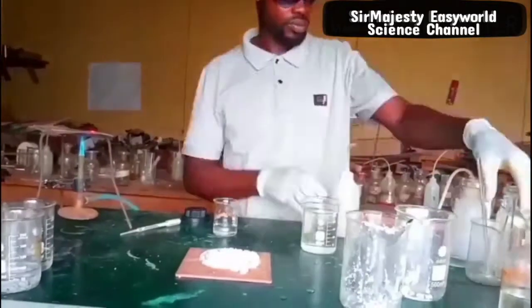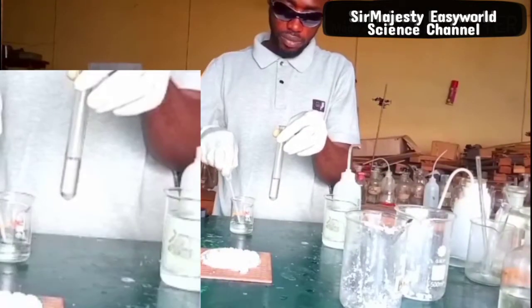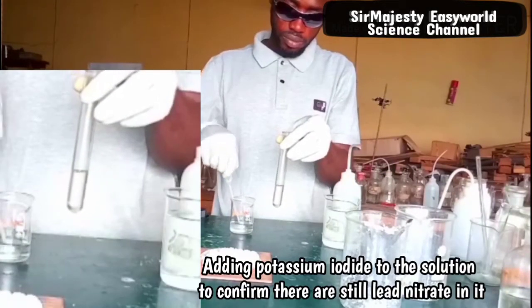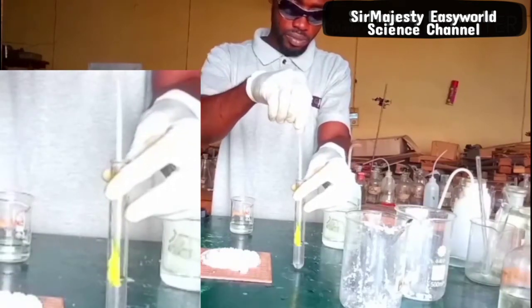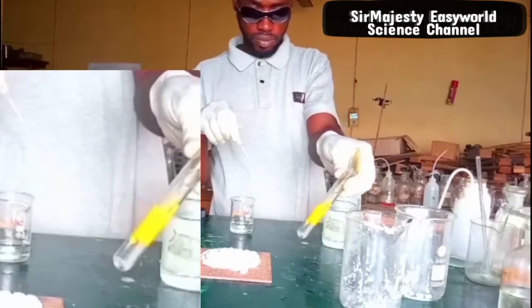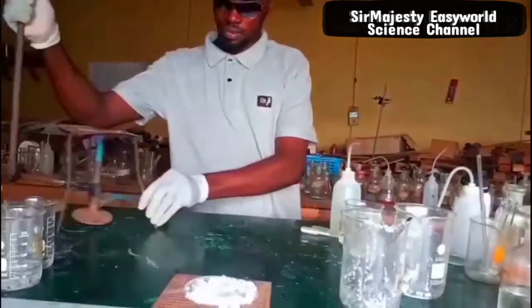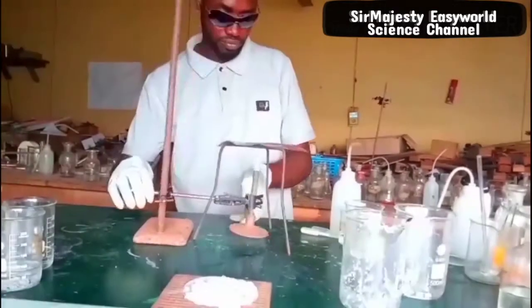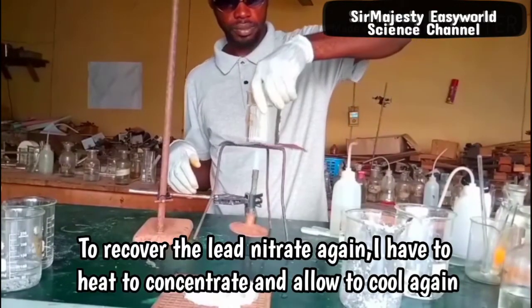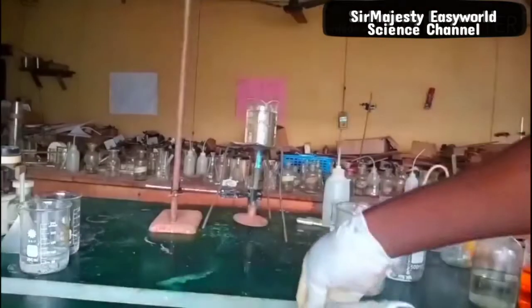Now I want to test if there is still lead nitrate in the remaining solution I decanted off. That is potassium iodide — I will add it to the solution. If it turns yellow, that is lead(II) iodide, which will only form in the presence of lead nitrate. I have reacted potassium iodide with lead nitrate and it turns yellow, showing that there is still enough lead nitrate in the solution I decanted. So I have to heat the concentrate again and allow it to cool; another crop of crystals will form and I will recover it the same way.